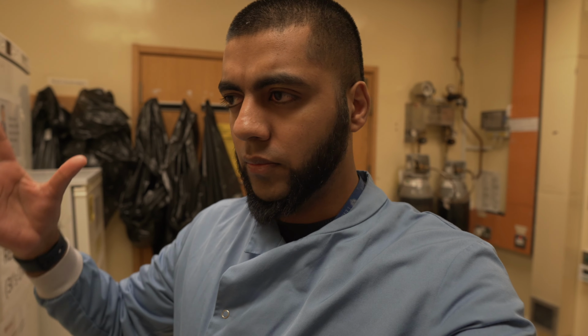I am back in the lab today, back with another lab vlog, and today we're talking about some of the reagents, chemicals, buffers, bits and bobs that I use in the lab that you may use, and sharing some advice as to why I use them, how I use them, and how you can make use of them. So if you're new, I did a lab vlog tour of the lab itself. Now I'm going to take the tour one step further and show you the stuff that I actually use.